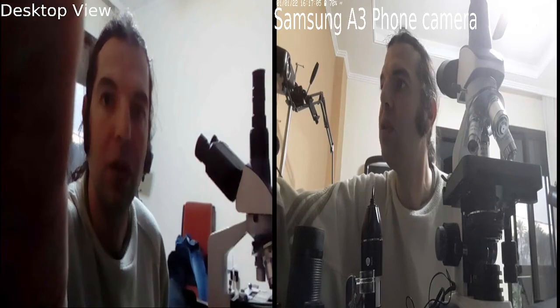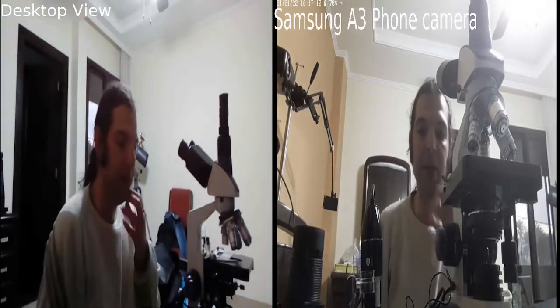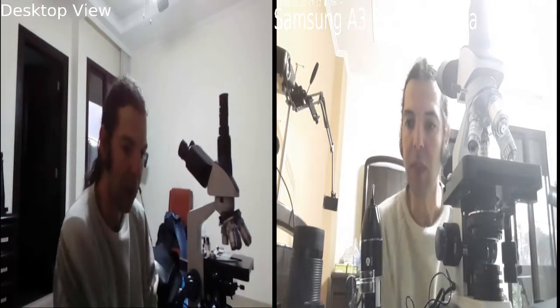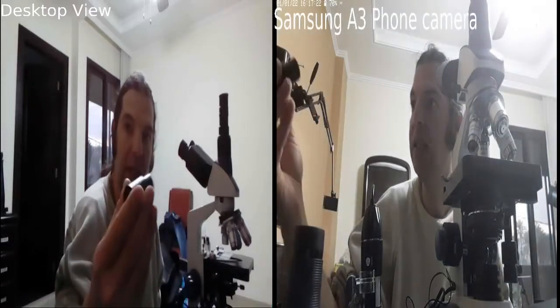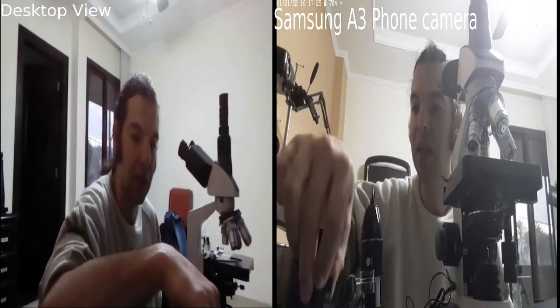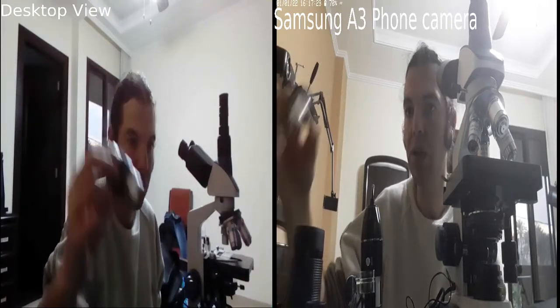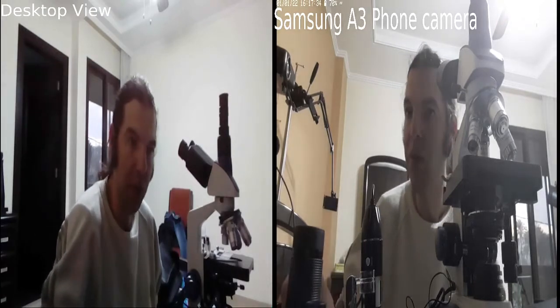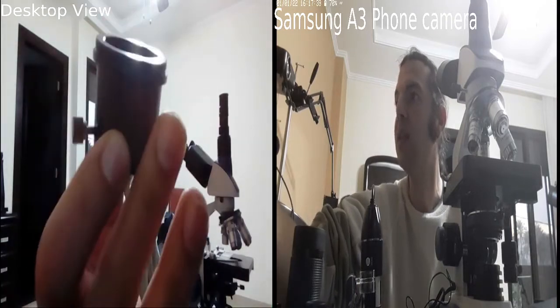There are also eyepieces with a diameter of 2 inches. This way on a microscope you'll get a wider field of view, because there are eyepieces for the microscope which are 30 millimeters, but telescopes have a wider one, so we can use them. How to use them is by using this adapter for the telescope. This is this little pipe here.